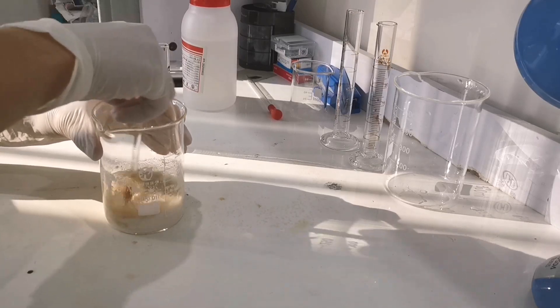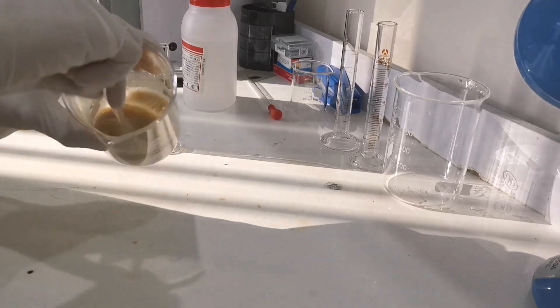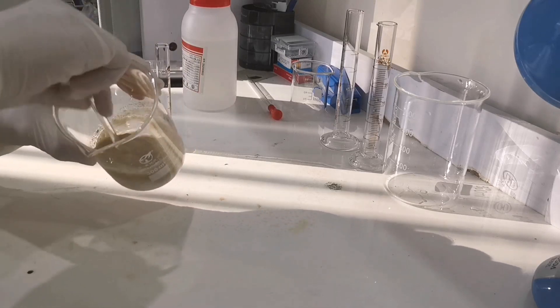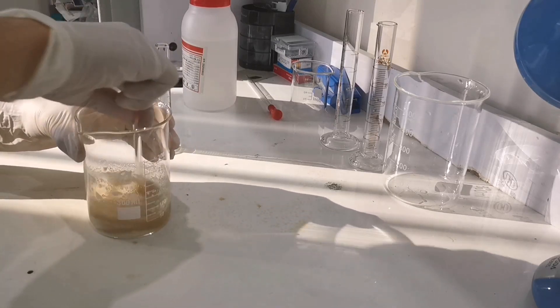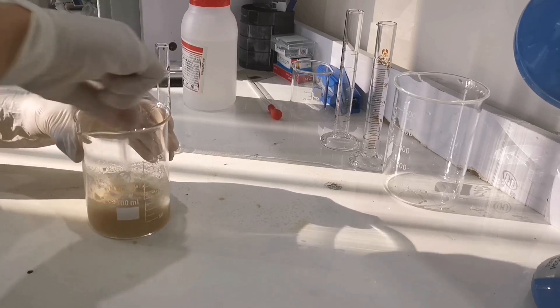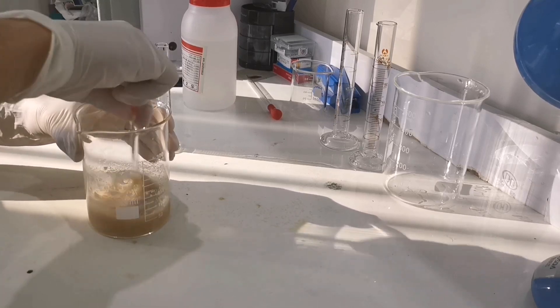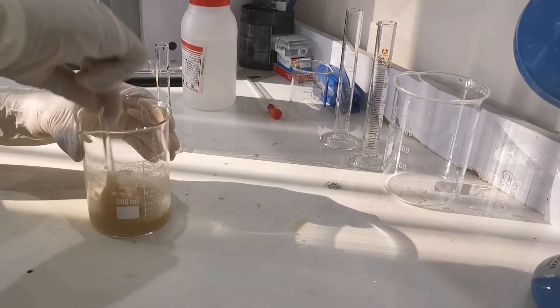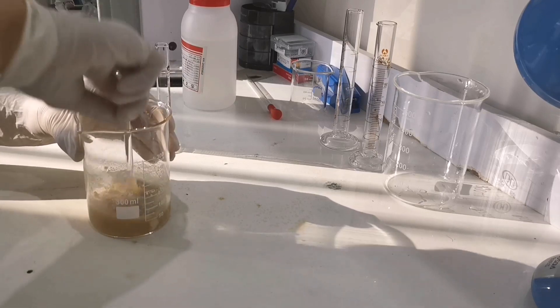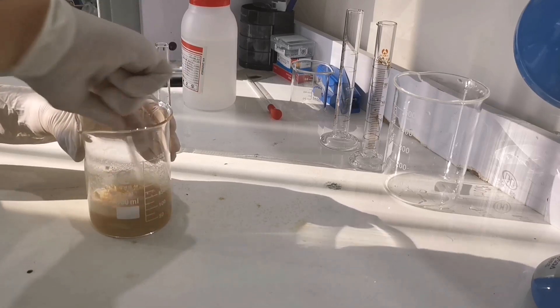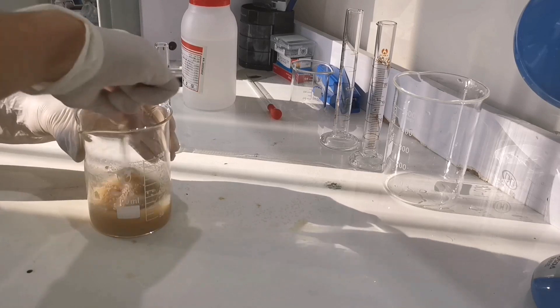You can see the color in the beaker change into dark yellow and the solution gets a lot stickier. Now it's time to give it a very good mix. Actually, there is no reaction going. The solution got stickier because casein has a very large solubility in basic solution.